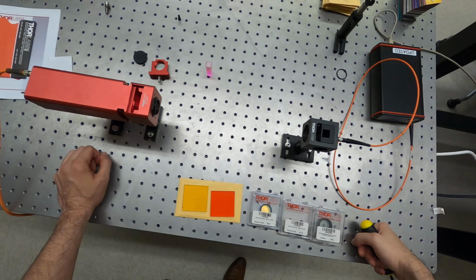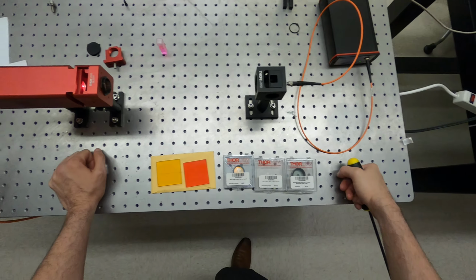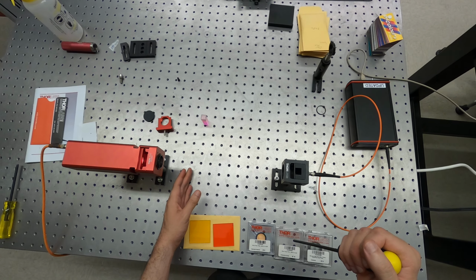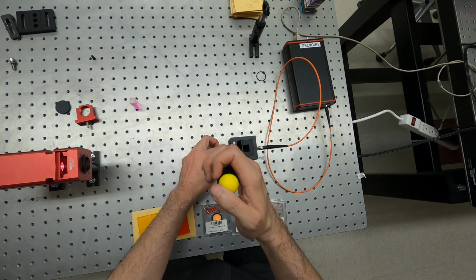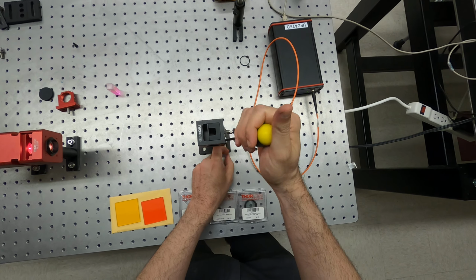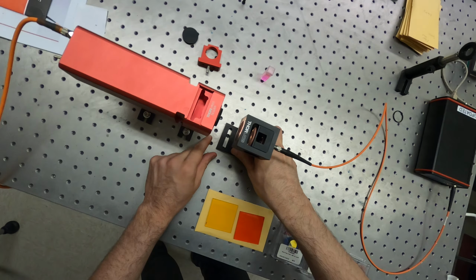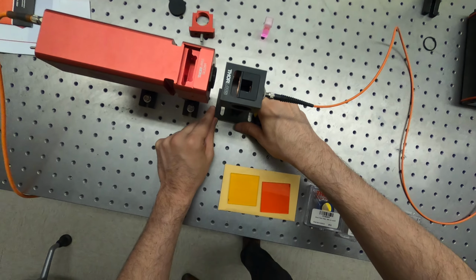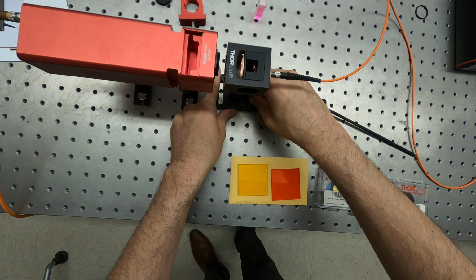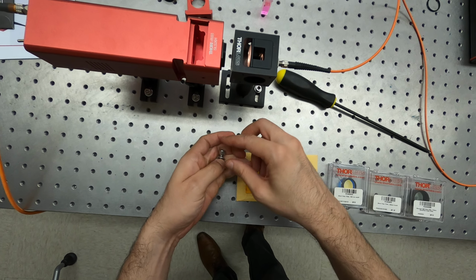Okay, so after measuring the absorption of this rhodamine solution, we proceeded to measure the emission of the same sample. So we moved this holder closer to the light source. Let me take this out from here. We'll bring it closer to the white light source. Okay, this hole fits well. This pair of holes, so we have one here, another there.